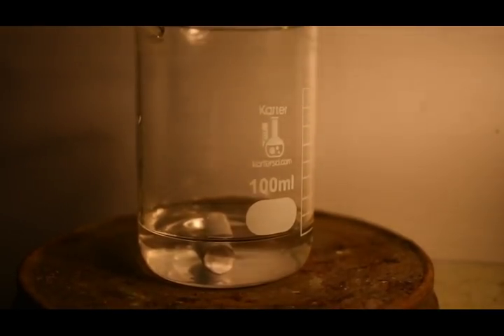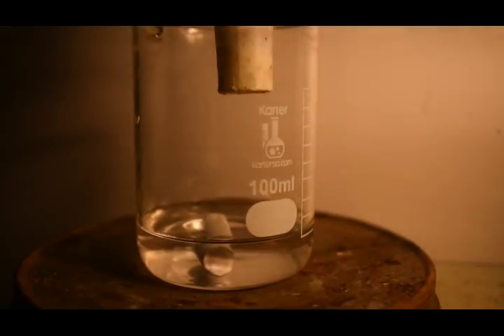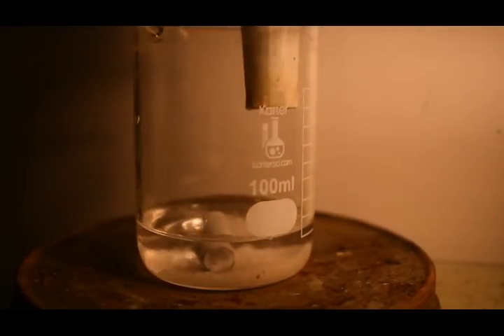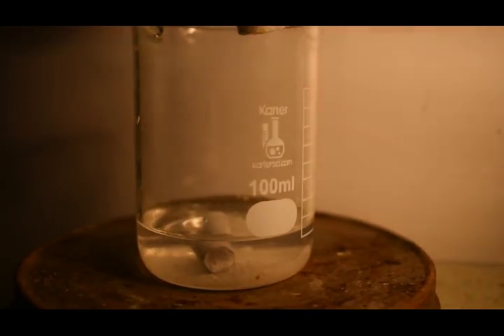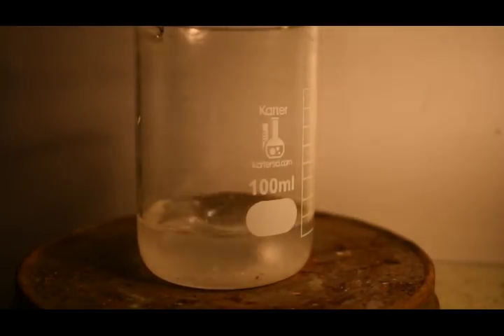Now I'm going to add the silver nitrate. It seems there was something on the funnel that I was using, and that's what that yellow stuff is, so don't mind that. That really probably won't mess up our synthesis. And now I'm just going to turn up the stirrer and get this dissolving. I'll come back when that's done.